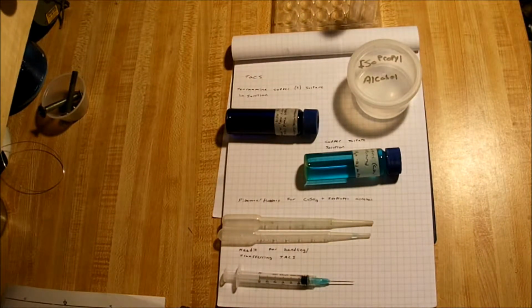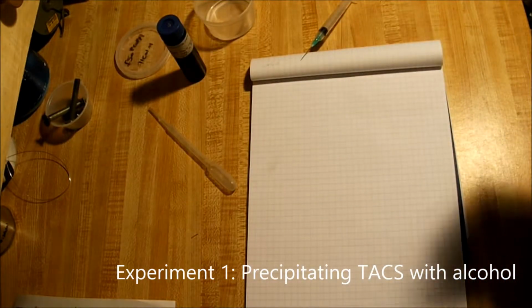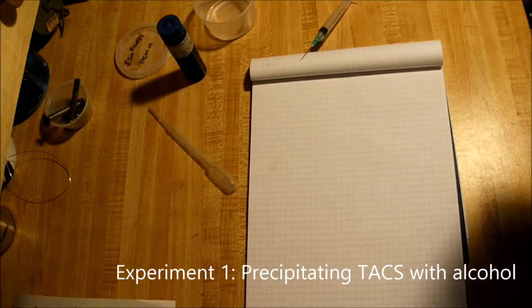Now the first experiment is we are going to precipitate it. The first experiment we're going to do today with the tetraamine copper sulfate is to precipitate it into its crystal or solid form. The first thing you're going to want to do is take one of your test tubes and fill it with, I'd say, about 5 milliliters of isopropyl rubbing alcohol or ethanol. Again, I didn't have any ethanol, so I just used rubbing alcohol. It'll work the same. As you can see, I've already done that.